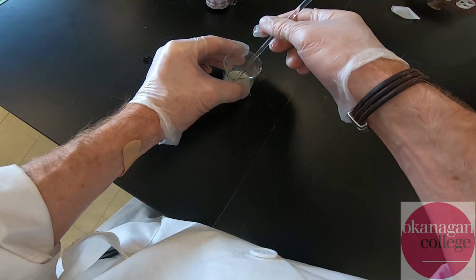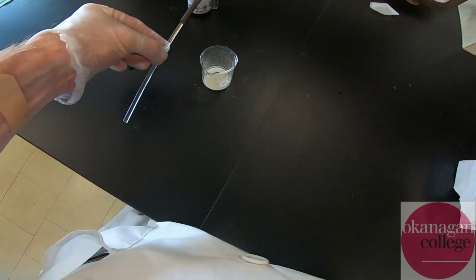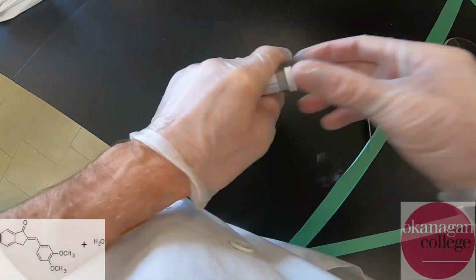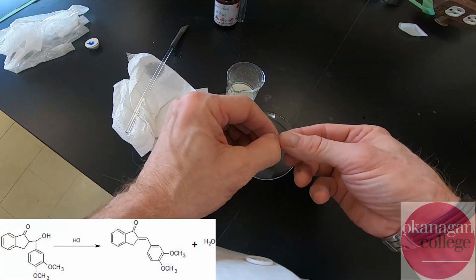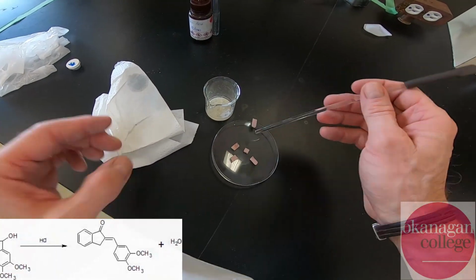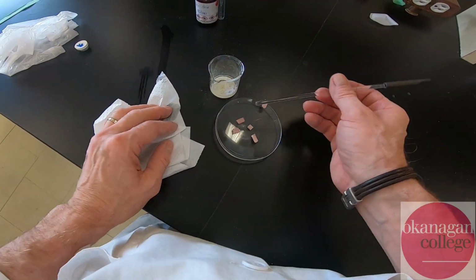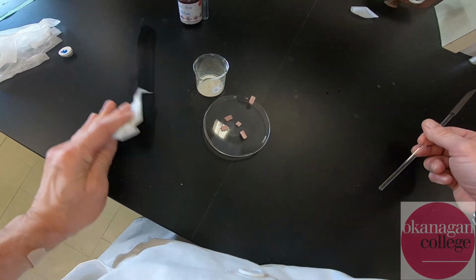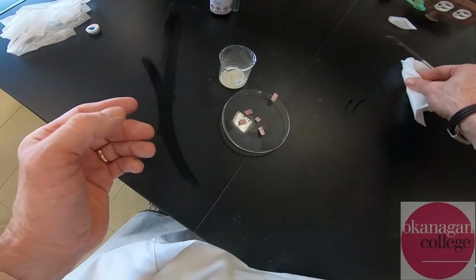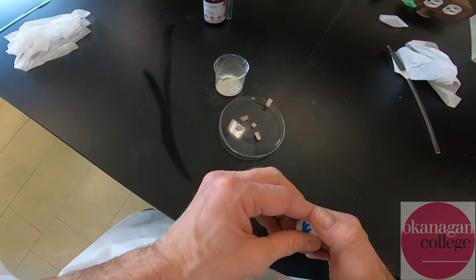We're going to test the pH to make sure it's acidic, and then once that is, we're going to try to separate that material using a centrifuge. And we have a pink or red litmus paper. This solution is nicely acidic. So I am sure that under the mixing and the stirring and the crushing of the solid that we've been able to complete the final dehydration reaction.